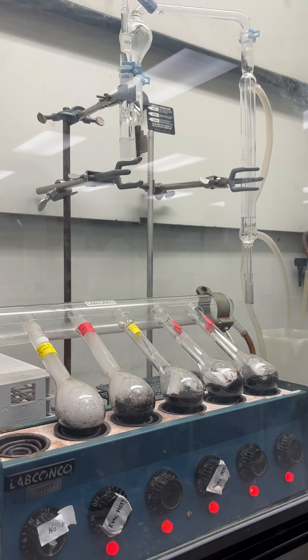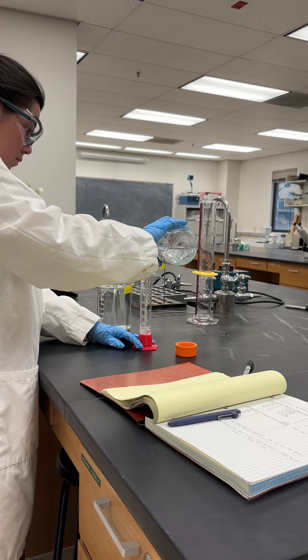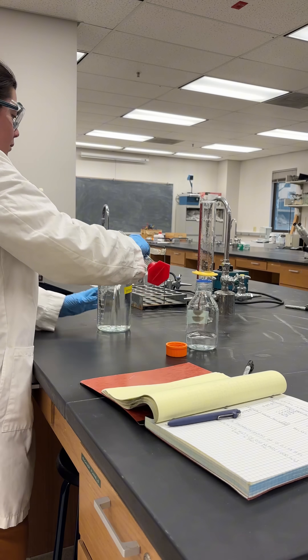After the foaming was solved, I let these samples digest to a beautiful apple green color that is produced by the copper sulfate in the digestion tablets. And while that was digesting, I had to standardize an HCl solution, which meant I also had to standardize a NaOH solution beforehand.